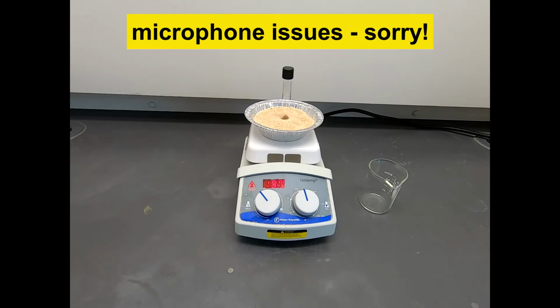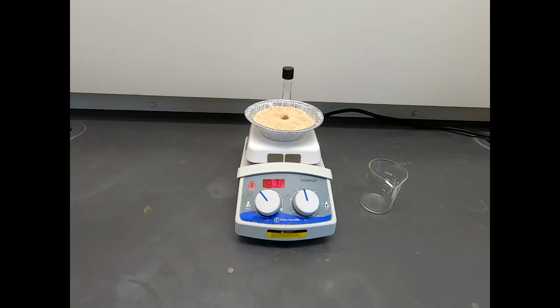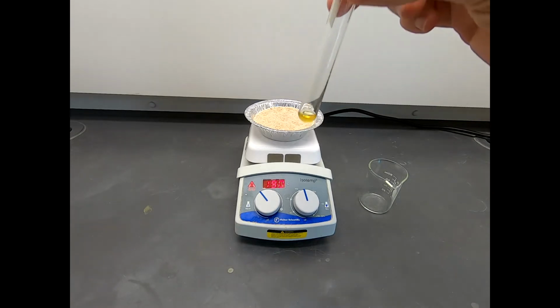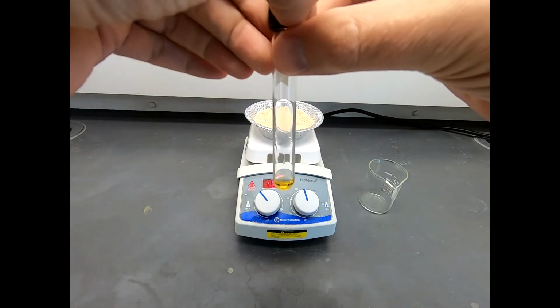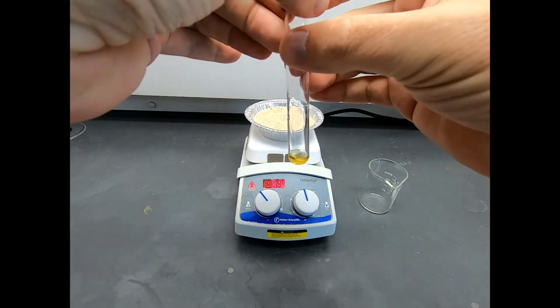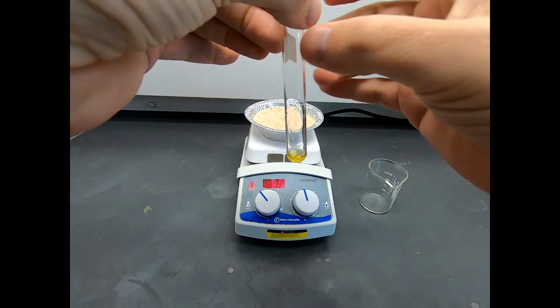Now this reaction has been running for about 1.5 hours, so it's getting close to being done. But I just want to show you what it looks like once it's already started. So I'm going to pull this out. I'm not sure if you can see, there is some kind of condensation liquid on the sides. That's what we hope for. So that's a sign we're getting good heating down here.